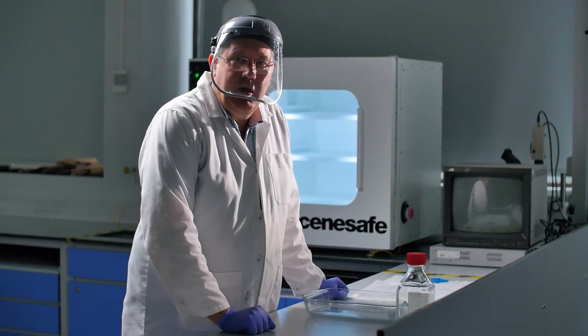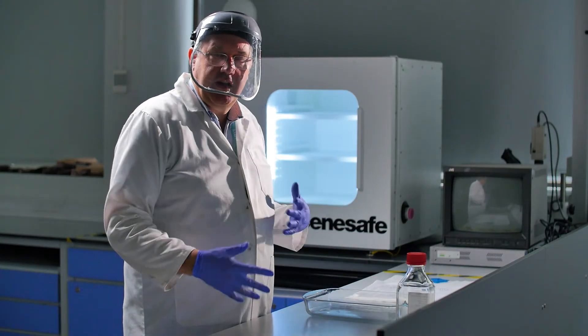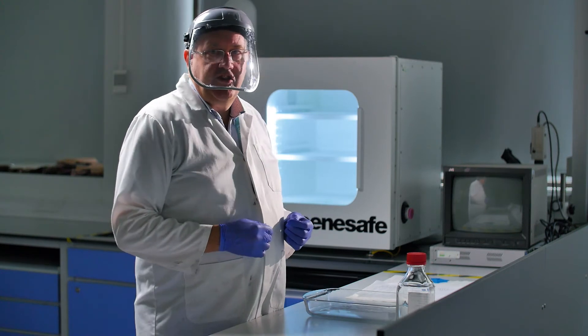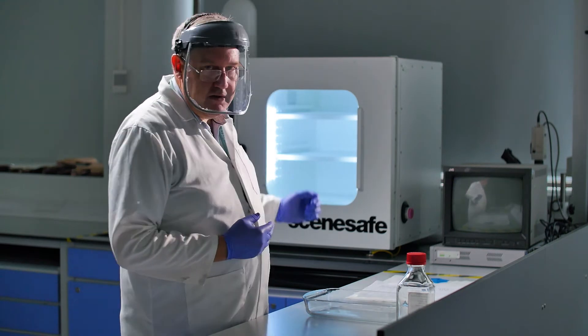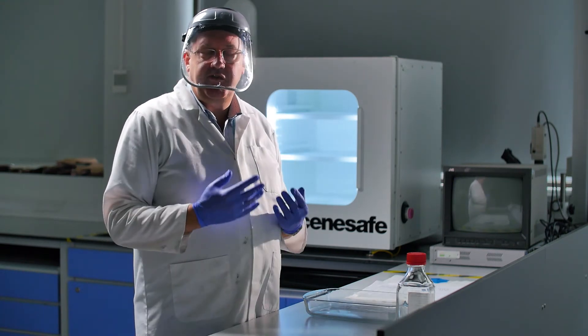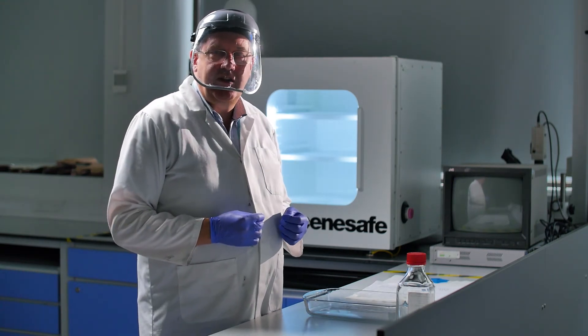And while that's drying, it won't take very long because this is a quickly evaporating solvent. I'll just tell you what I'm going to do next. I'm going to put both these sheets of paper into this oven behind me which is kept at 65% relative humidity, 80 degrees centigrade.